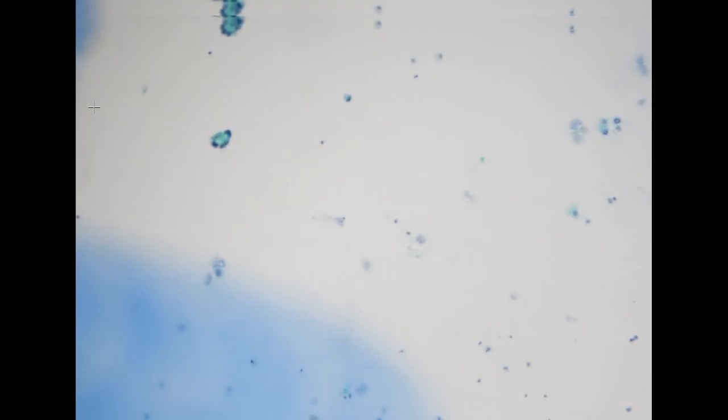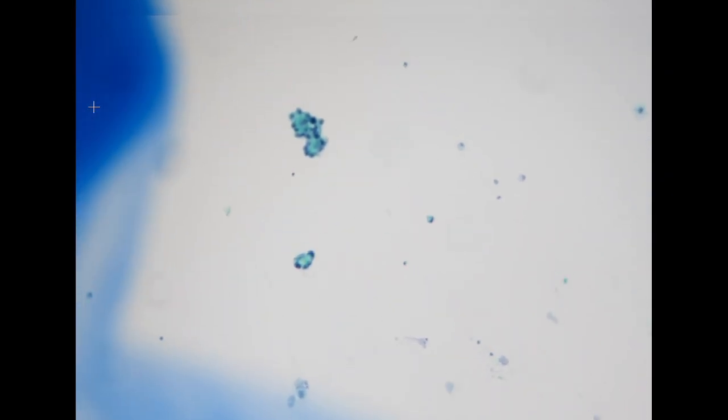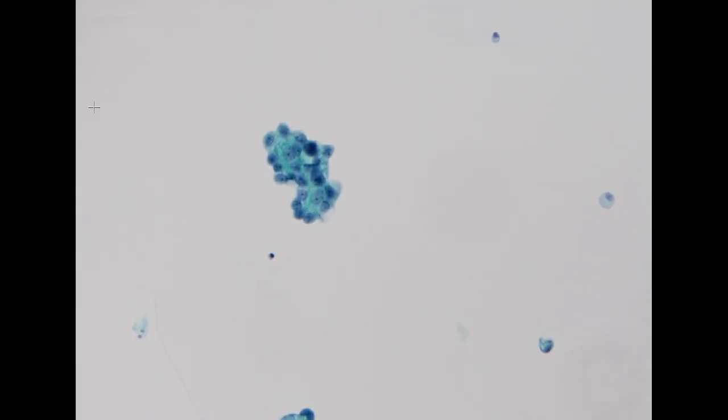So next specimen, this is also a peritoneum washing specimen. The patient also has endometrial cancer, but this time, just based on the operation notes, the cancer is in high stage. It already showed omentum cake, unlike the prior patient, where it was very clean throughout the entire abdominal cavity.